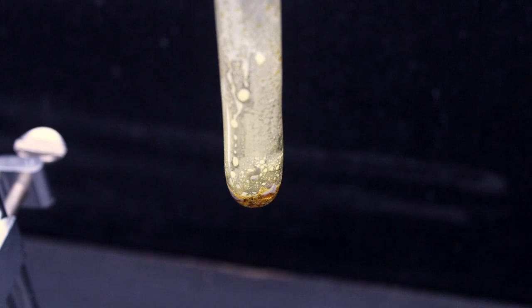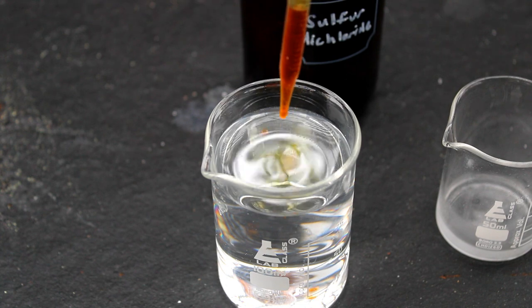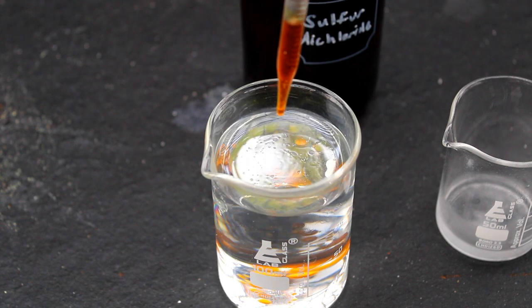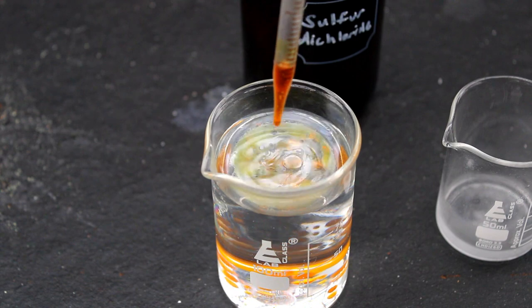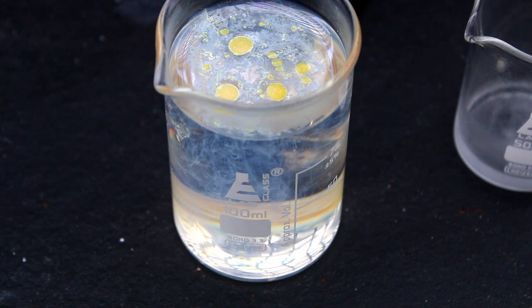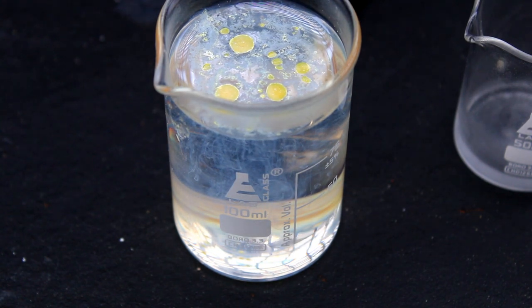Overall, the reactivity of sulfur dichloride seems a bit underwhelming so far, so let's move on to a few solvents. First up, let's try water. Huh, this reaction is actually a bit tamer than I imagined, but that actually makes sense. Sulfur chlorides produce sulfur when they react with water, and sulfur coats the droplets of sulfur dichloride, preventing them from reacting further. Of course, the sulfur dichloride does eventually leak out and turn into fine precipitate of elemental sulfur on contact with water.